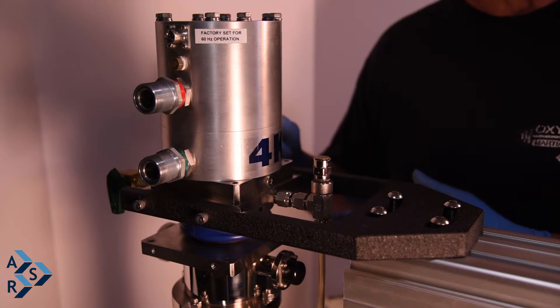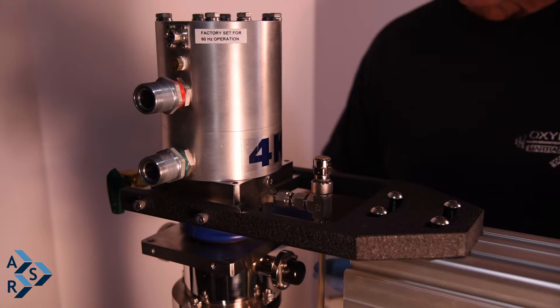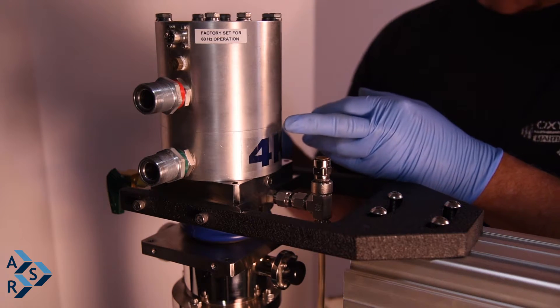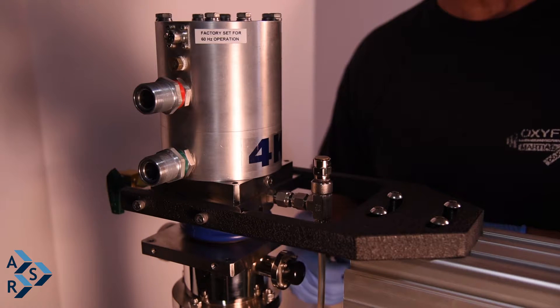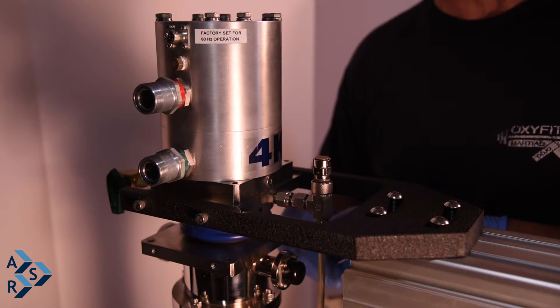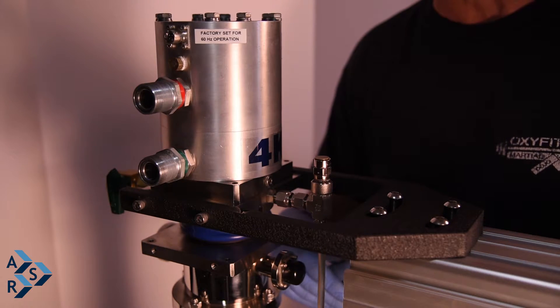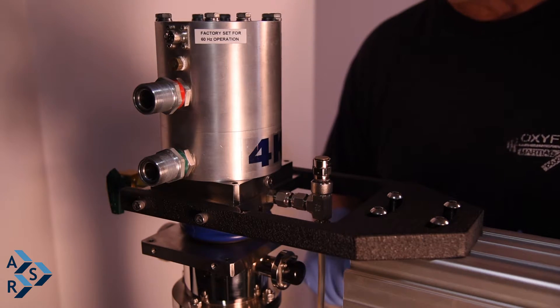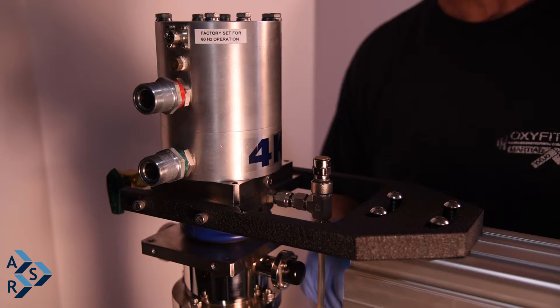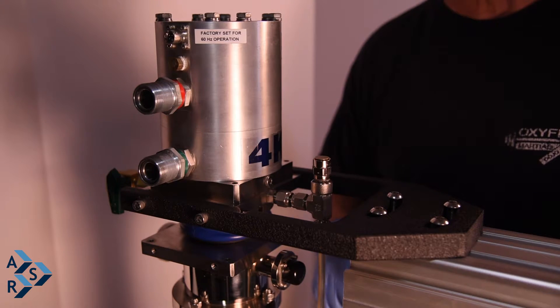For maintenance, after about 20 cycles, take the cryostat out of the annular space, inspect it, and clean it with isopropanol. 3M has a scouring pad — you can go in there and clean the copper to a brighter finish to remove oxidation that may occur after running it many times without drying it out properly. This will help maintain the system so you get the best temperature and it will work a lot better.